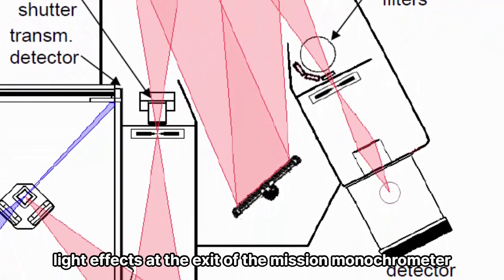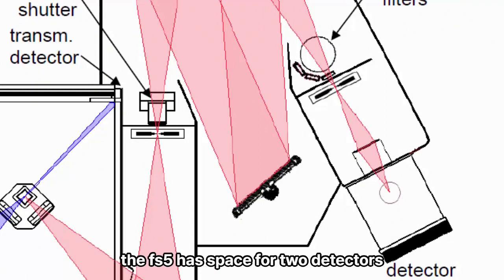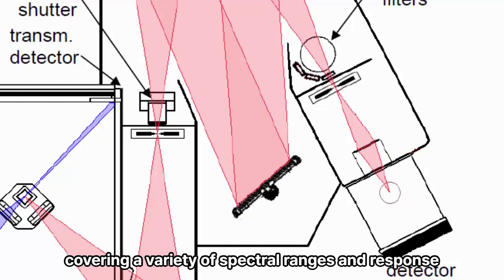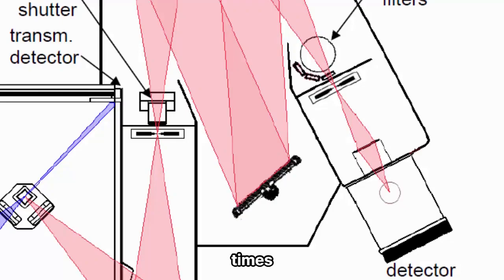At the exit of the emission monochromator, this is where the detectors are located. The FS5 has space for two detectors, and they are usually PMTs or photomultiplier tubes, covering a variety of spectral ranges and response times.